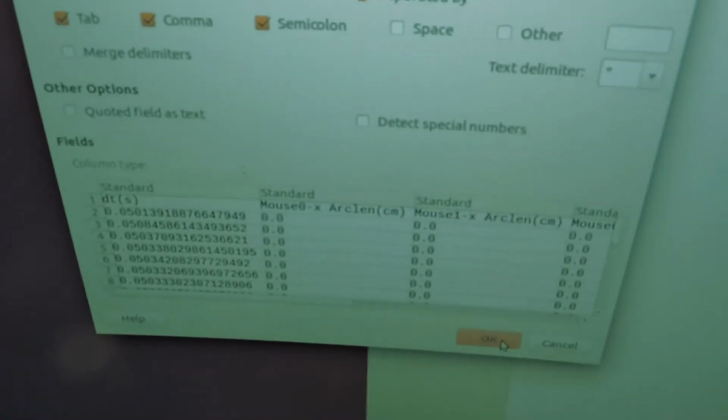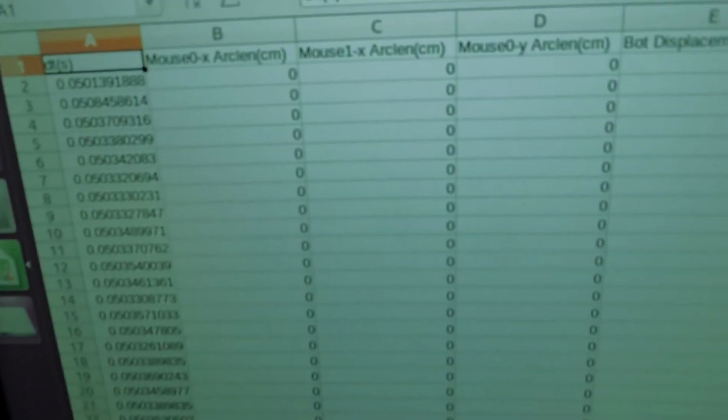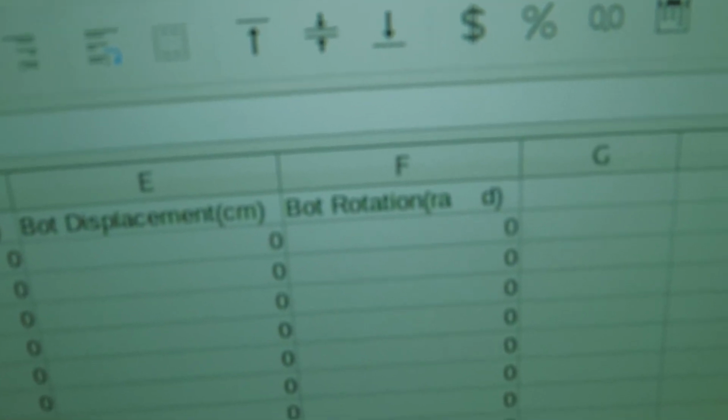And then likewise we have all of the trackball data. Of course we have to import it as a CSV. So this can show us, this is a dry run obviously, the change in time between each update, the arc length along each axis, and the corresponding bot output.